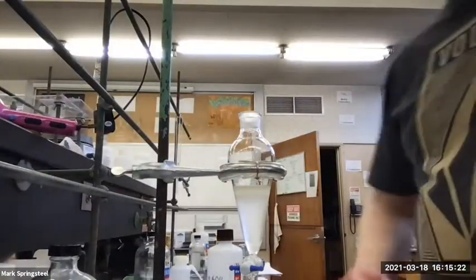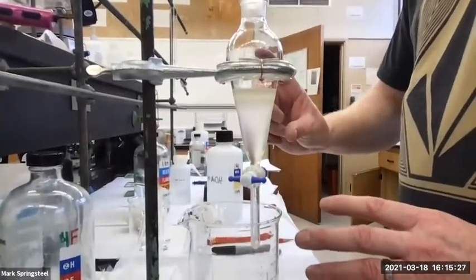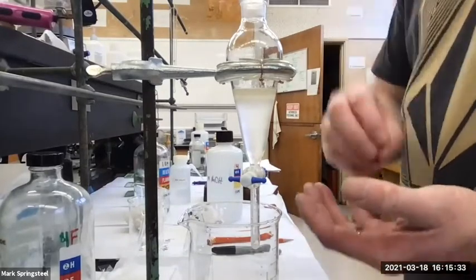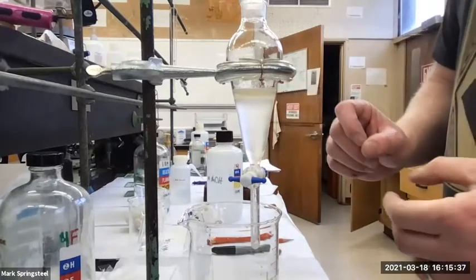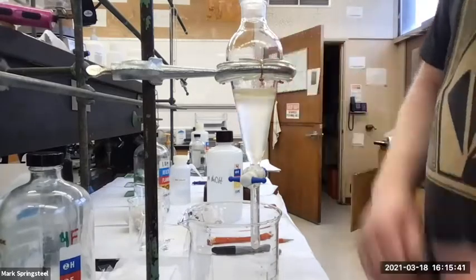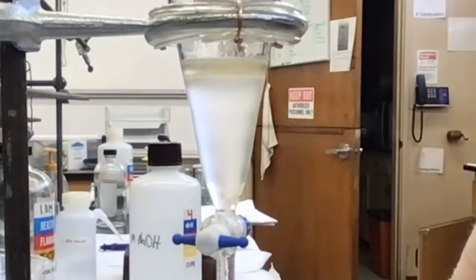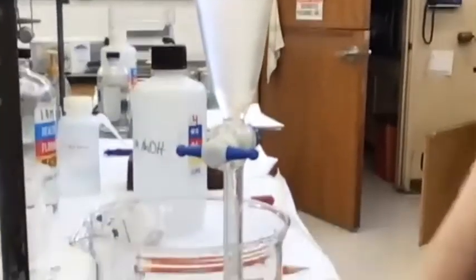If you just take pure methylene chloride and water and shake them up in a separatory funnel, the mixing is actually exothermic. It creates a little bit of heat, and that heat takes the methylene chloride, which has a low boiling point and high vapor pressure, and creates a little bit of pressure. So you don't even need a reaction to take place. Gotcha. Would the same thing happen with diethyl ether? Yes, even more so. It's more volatile.